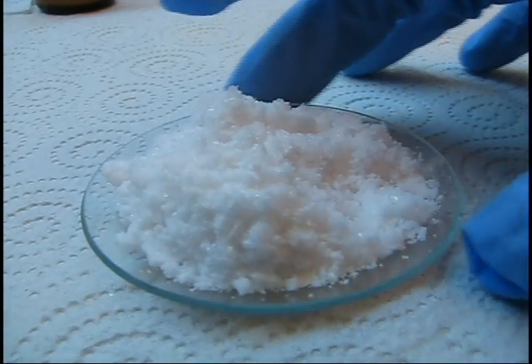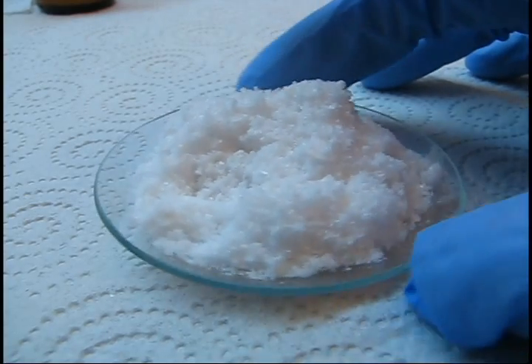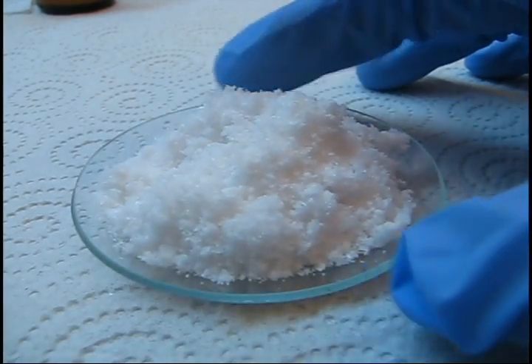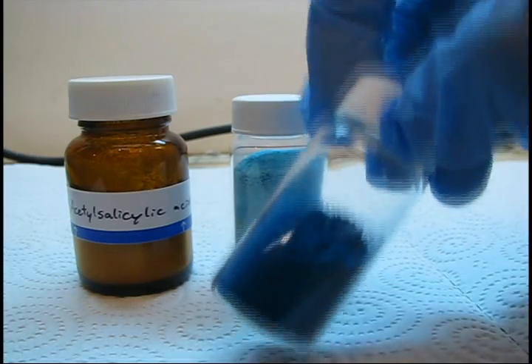Here is a close-up shot of the final recrystallized acetylsalicylic acid with larger crystals than the original powder. In an upcoming video, I will demonstrate the synthesis of the transition metal complex copper aspirinate.